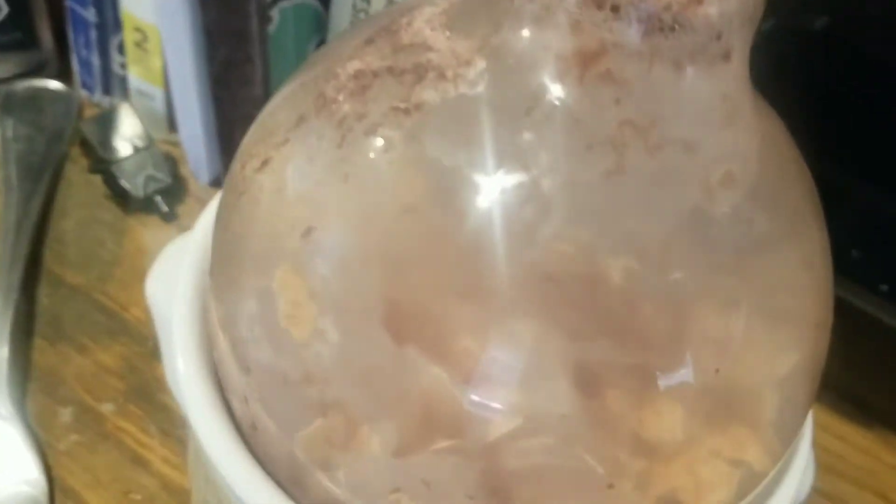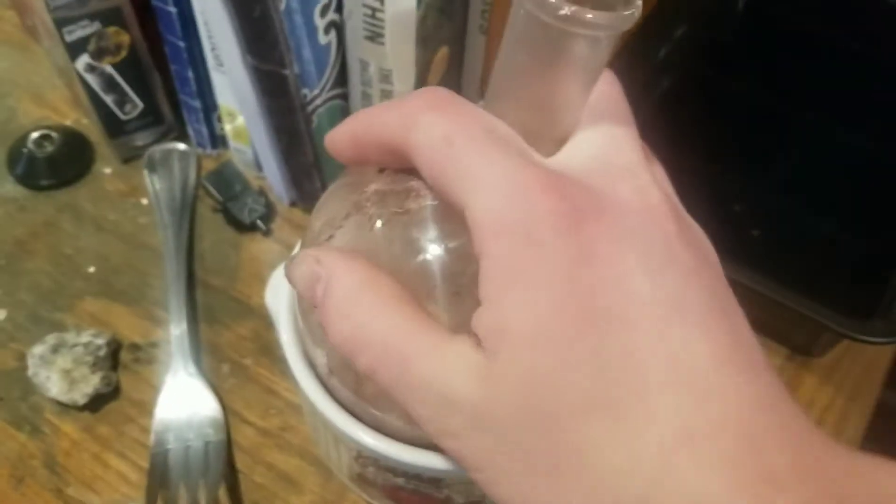So, what I'm doing here is I'm dissolving eggshells in vinegar to make calcium acetate. It's been reacting for a little while — as you can see, it bubbles a lot, and there's all this little brown flaky stuff. We're going to filter all of this out, but it's not done reacting yet — it's been 12 hours. It can take up to two days for this reaction to finish.